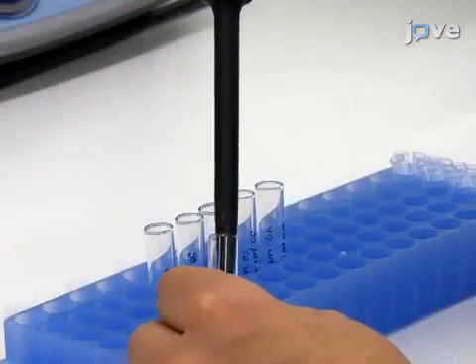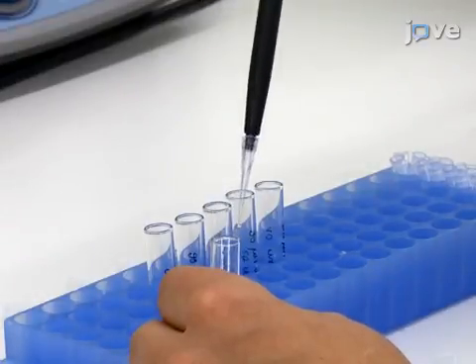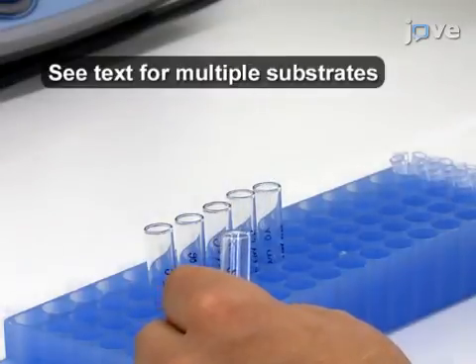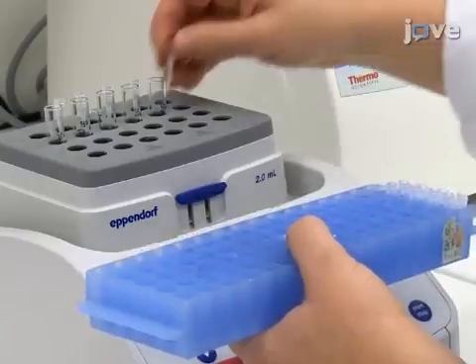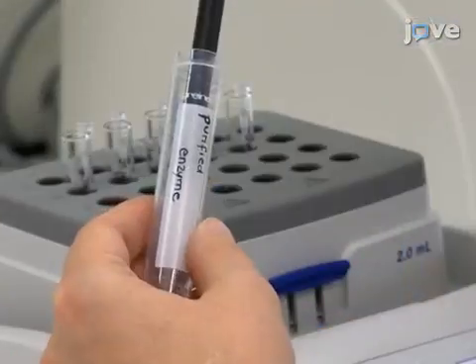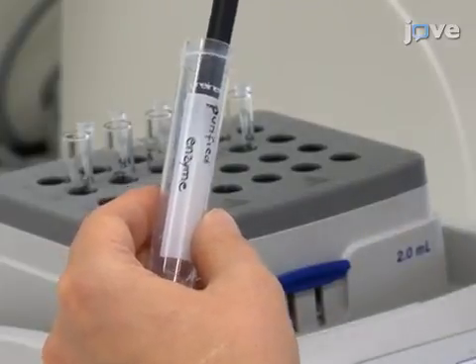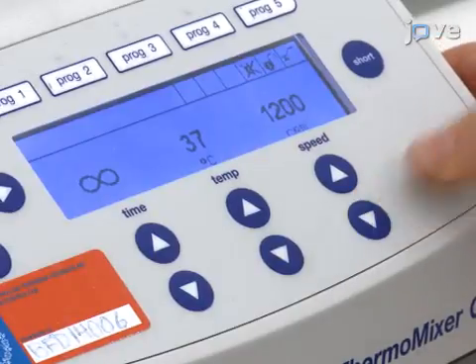For single substrate kinetics, dilute the emulsified substrate into at least 5 glass vials to the same final substrate concentration. Pre-incubate the glass vials in the thermomixer for 10 minutes. Start the reaction by adding the enzyme. A total reaction volume of 1 milliliter is suitable. Use a shaking speed of at least 1200 RPM.